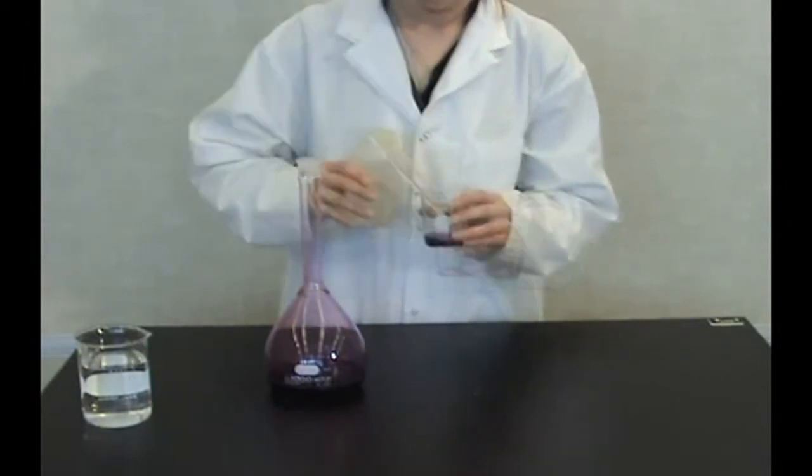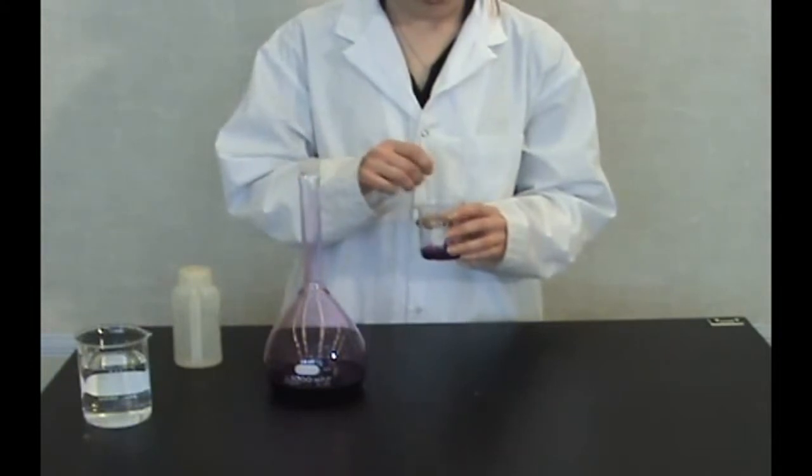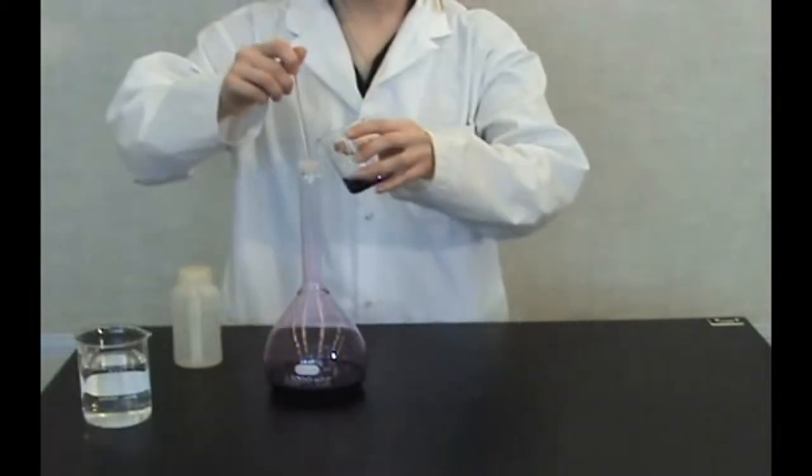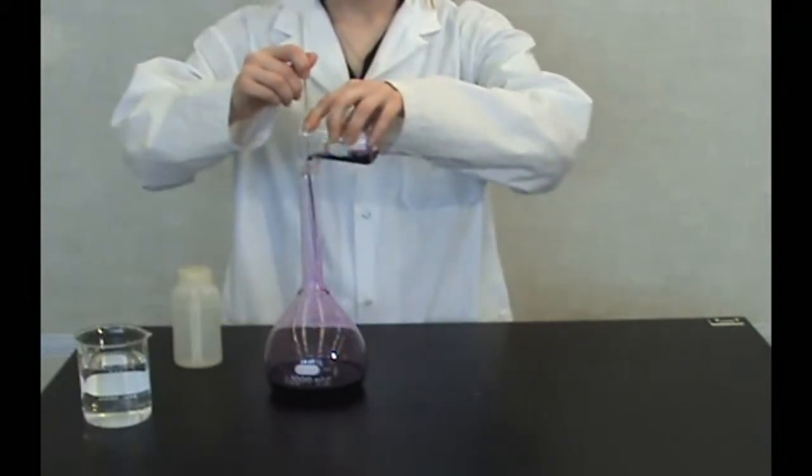Rinse the beaker quantitatively with sufficient solvent. Do this repeatedly until all analyte has been transferred to the flask.